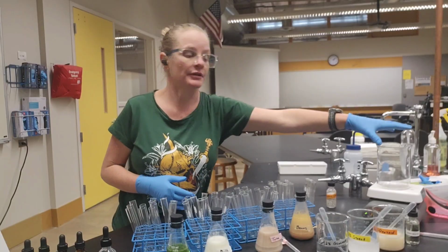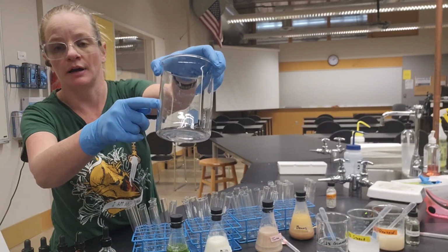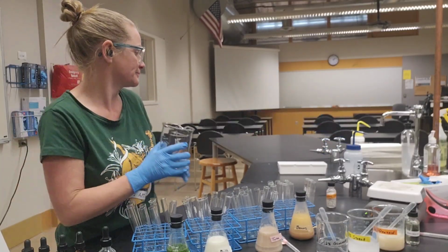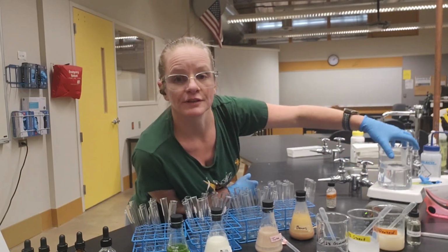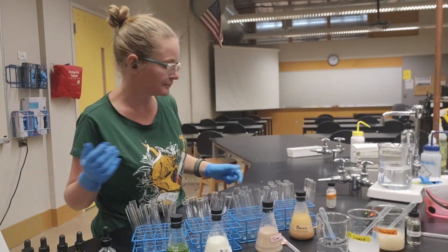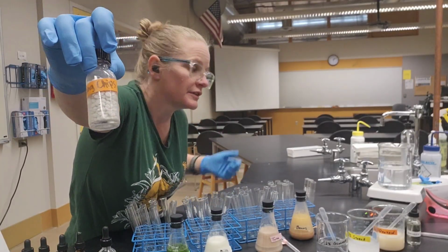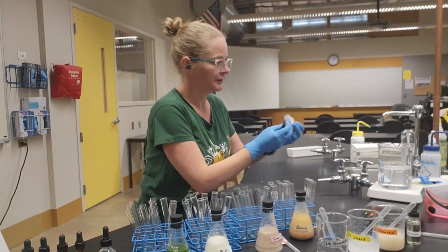So the first thing I'm going to do is actually get that set up. I've got my beaker. I'm going to fill it up about halfway with regular tap water and get it cooking on this hot plate. Okay. And I'm just going to turn that all the way up. Once it starts to boil, then I can turn it down just like you might do if you were cooking pasta. I'm going to add some of these boiling chips. This is a lab safety consideration to prevent this beaker from boiling over. So they only need a couple of three.